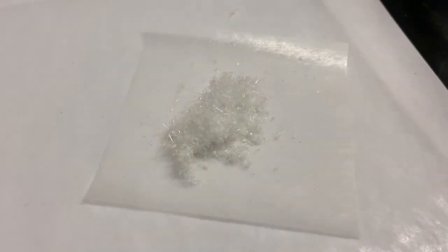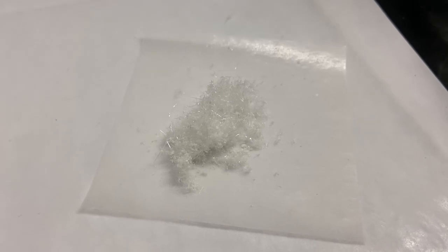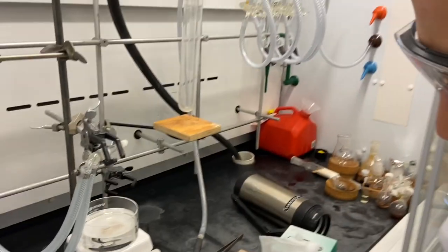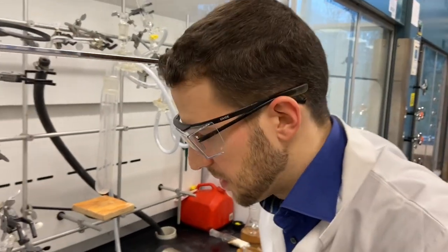And there we are. This is most of our crystals. Some may remain in the glass, we can easily resublime it. Now let's try to get it into the glass vial.